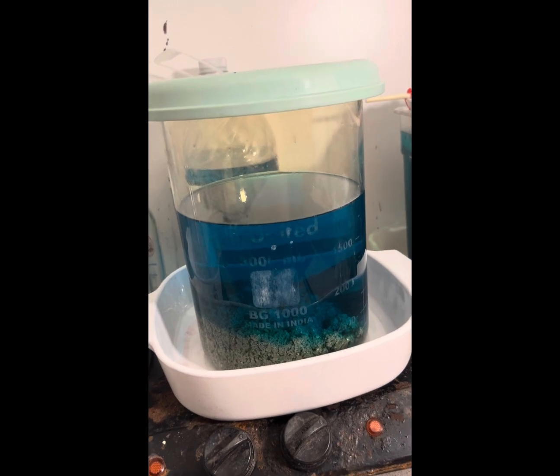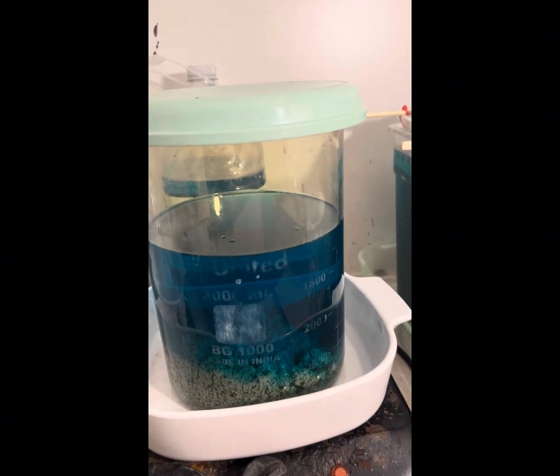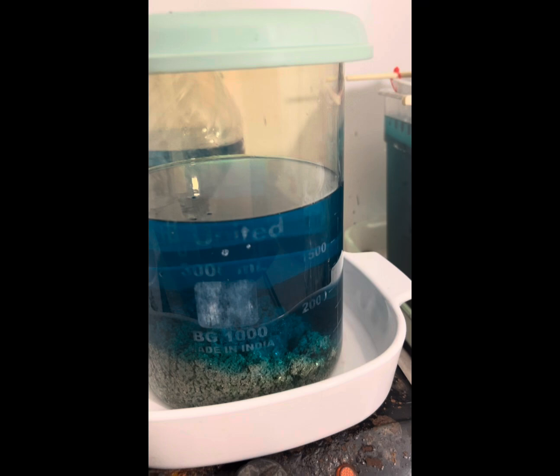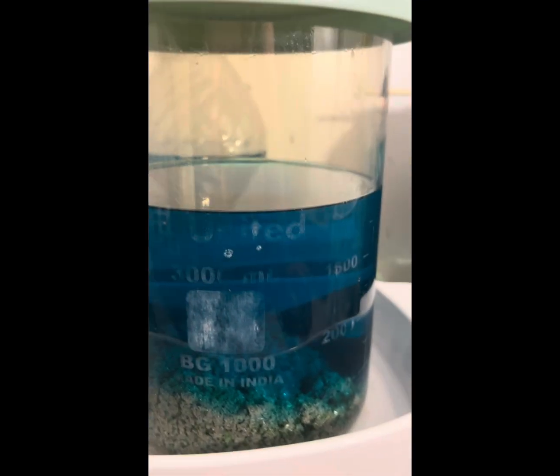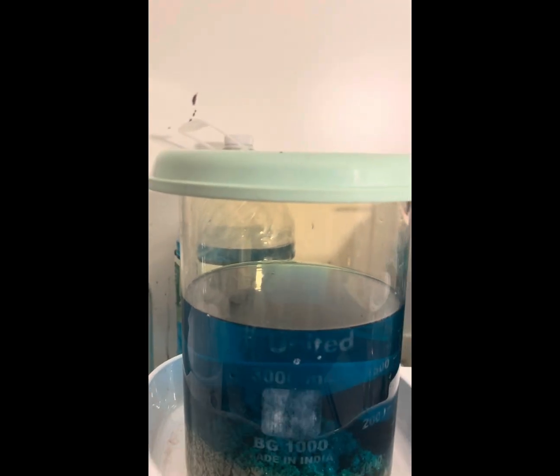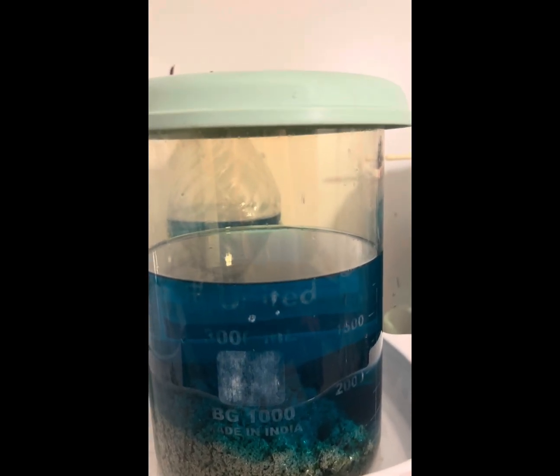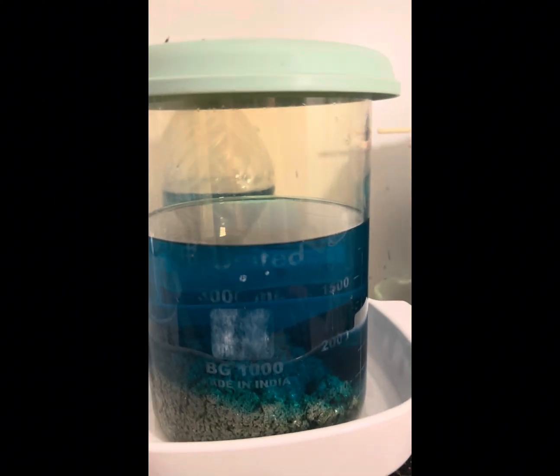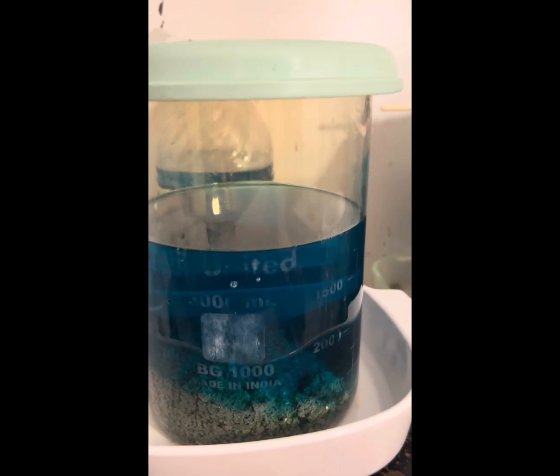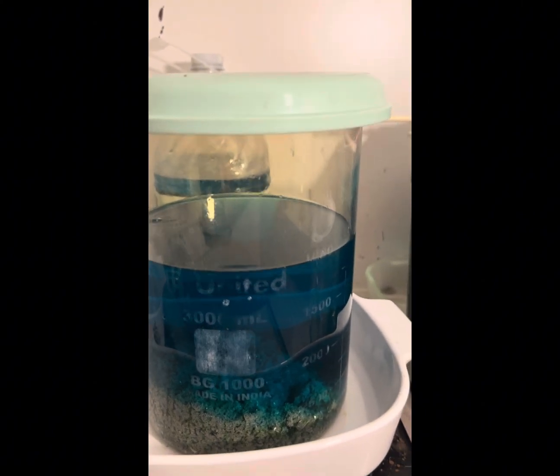Welcome back — you can see here this is the silver we have been working on from the copper and silver slimes. I'm going to give that a quick stir so it's not sitting in the copper and to get everything in contact. We still have a little bit of free nitric in there — I can see a slight orange tint and that bubbling. I probably should put some silver in there to make sure I use it all up. I'll stir it up, come back later, and probably pull that solution out after 24 hours and start cleaning up the cement.